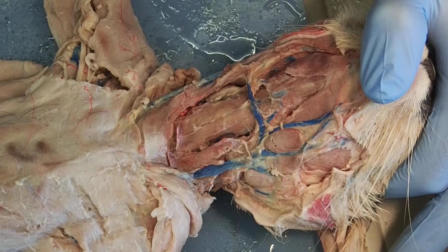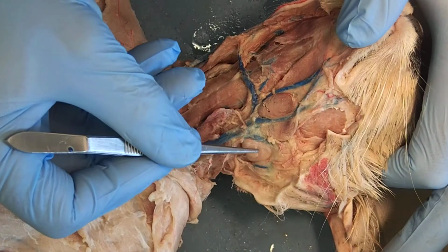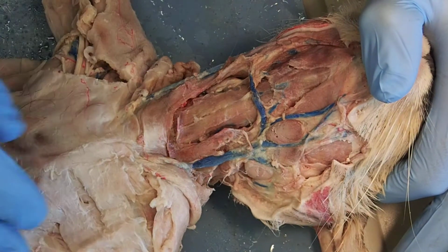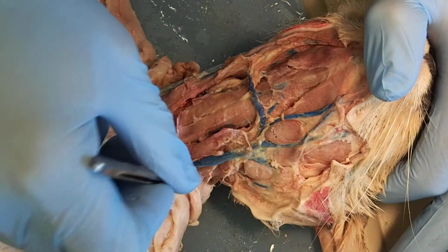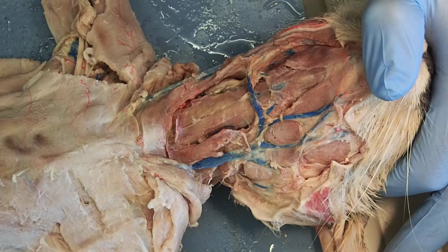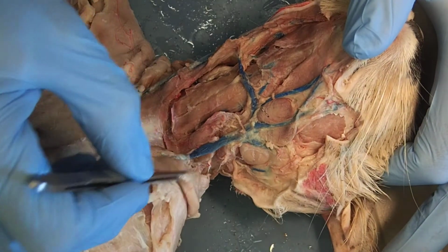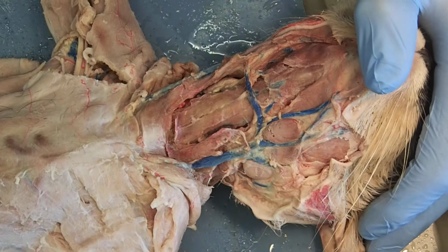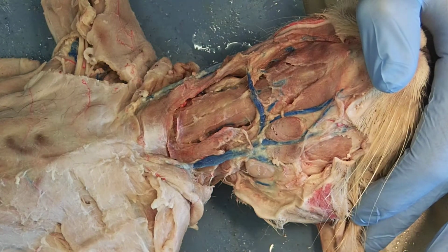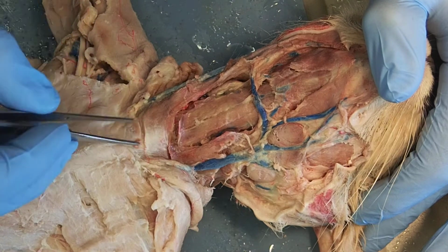In addition to the mandibular gland, I also have my parotid gland, which you can see part of up here. So from last time when we were learning the arm, we saw joining up here was my clavotrapezius. It joins here and it wraps around towards the dorsal side of the cat. And that was that most anterior trapezius muscle that we learned. It's on both sides here, and it joins basically right around the sternum.